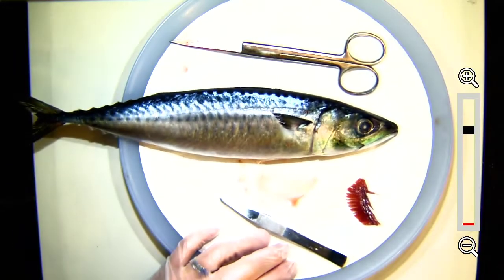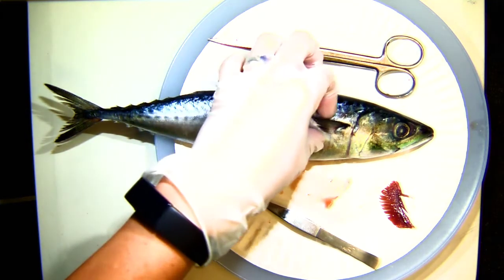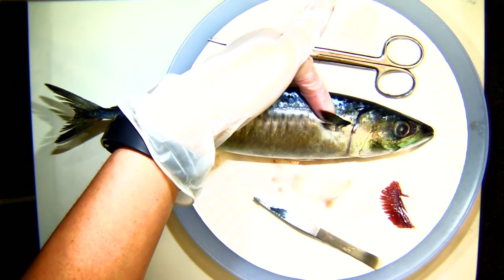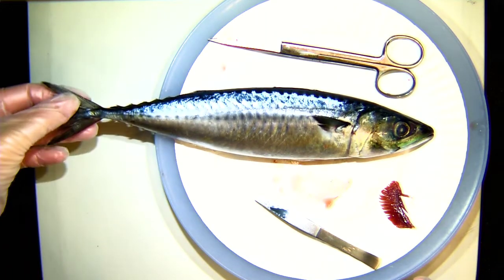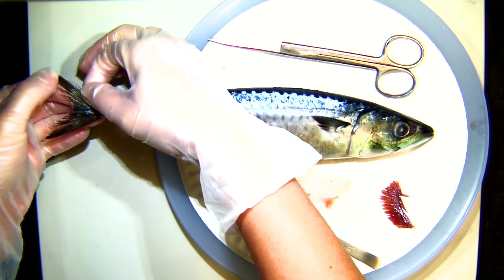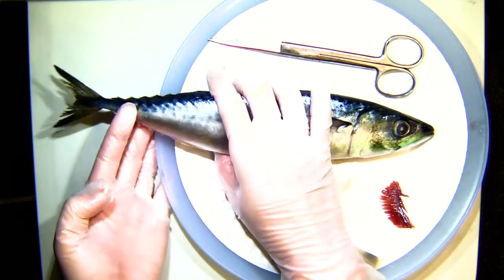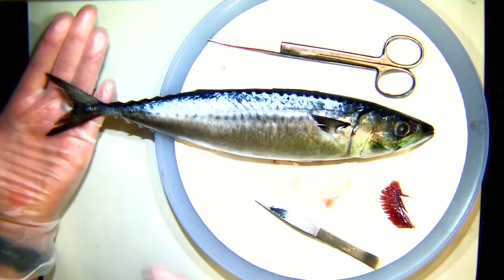We actually have pectoral muscles too — that's kind of what our arms are more or less attached to. So those are their side fins, these pectoral fins. For this fish, the pectoral fins are used to help them steer when they're swimming. What it uses to propel itself is mostly its tail. We can see the tail here — it's also called a caudal fin. Just like the pectoral fin, you'll notice there are rays, all these lines. So these are kind of bony rays that are part of this tail. The tail moves side to side and pushes the fish through the water.